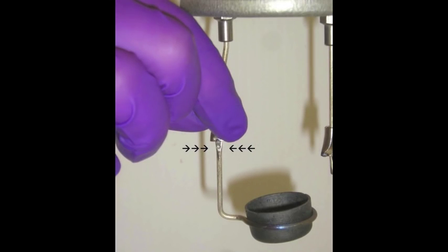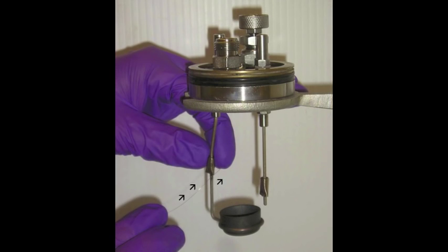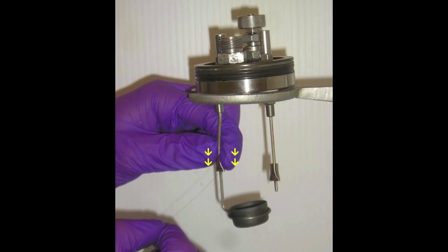You may have one of the newer bomb heads which have holes drilled in the electrode posts and sliding caps above those holes. In this case you don't need to twist the fuse wire around the electrode post. Just thread the wire through the hole like threading a needle. Once you have a short length of wire through the hole, slide the cap down to hold the fuse wire in place.